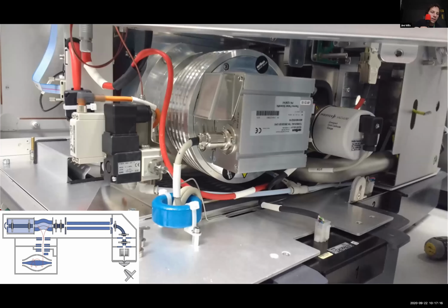So everything on this schematic occupies quite a small part of the instrument, really. It's kind of in a plane, not a mathematical plane, but about that height, I guess, about a hand's width, if you spread your fingers. So it all occupies that kind of space within the instrument, and there's loads of space in the instrument above and below that, filled with other things that are not directly mass spec things. They just set up the right environment.